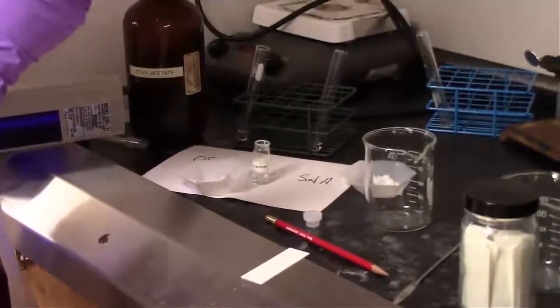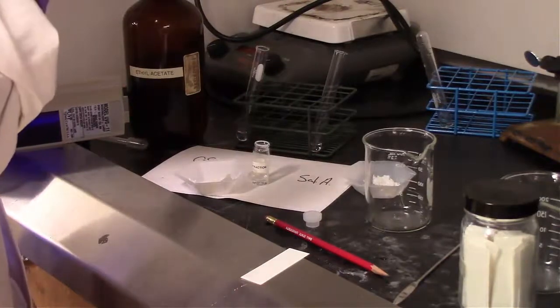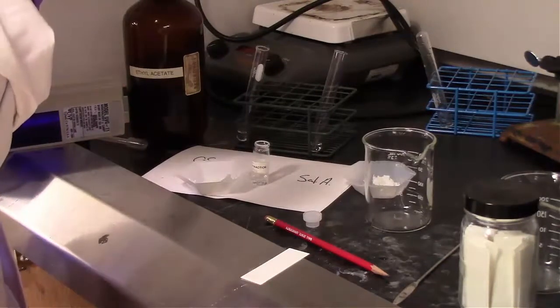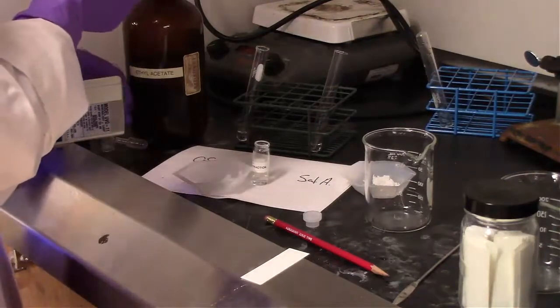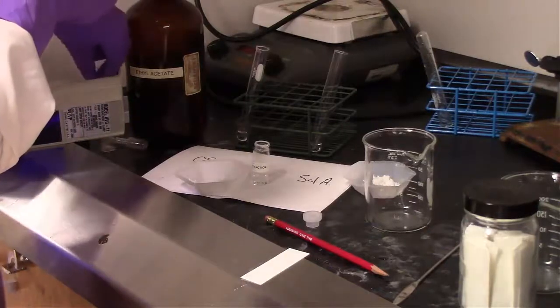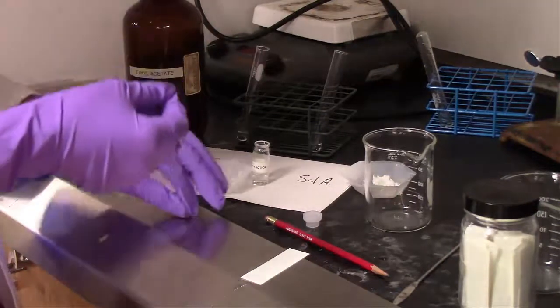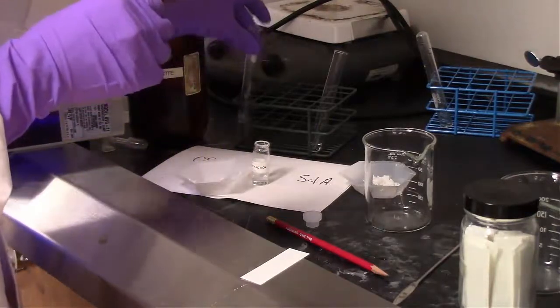So if you were going to do this lab, then you'd have visual observations of about how much solid you should add in. And like I said, it's okay if you're a little bit concentrated with compound dissolved in the solvent, because you can just make one tiny spot and be done, check it under UV light, and you're good to go. And if you need to spot a little bit more, then you still can.